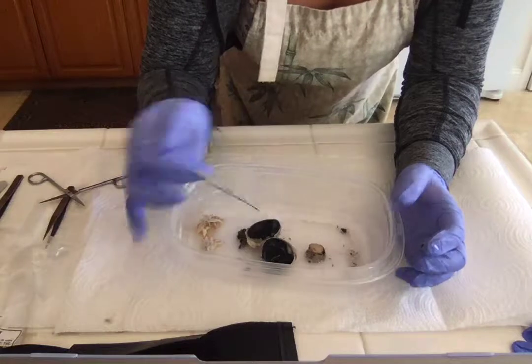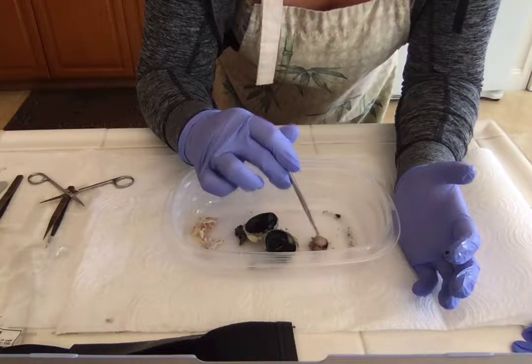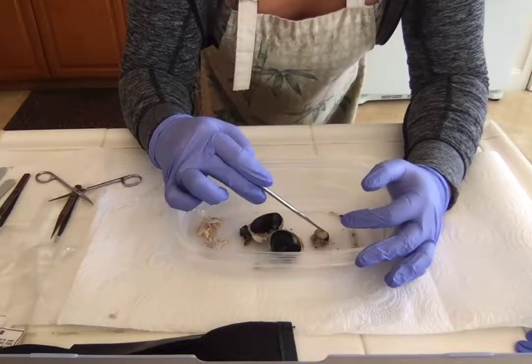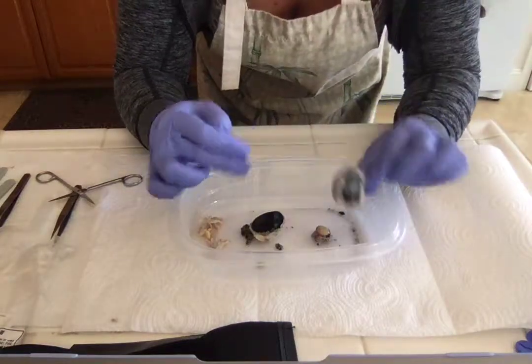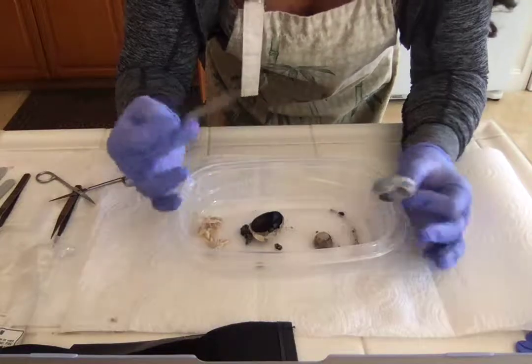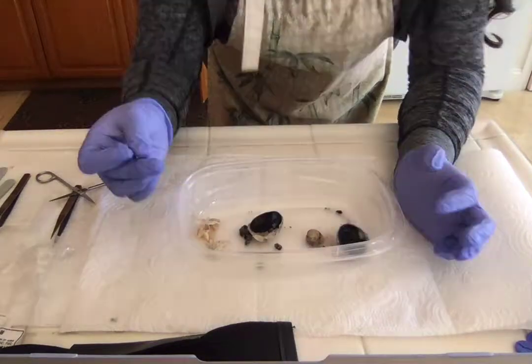Normally this is clear, but due to the preservative, it denaturized the protein, which made it hard, opaque, and not freely movable. But this is what happens when someone gets cataracts. It becomes opaque, known as milky. And when it becomes milky, light cannot enter through here, focused on here to the retina in order to have clear vision. So I thought it was interesting to actually see kind of a cataract eye, and how it needs to be replaced in order to let light information be processed into the eye.